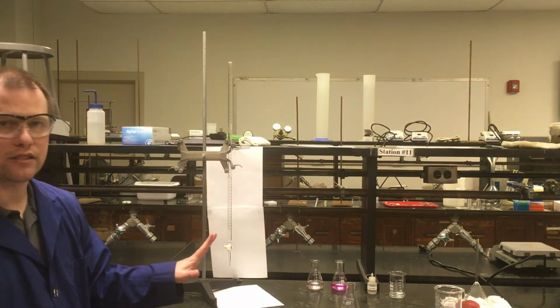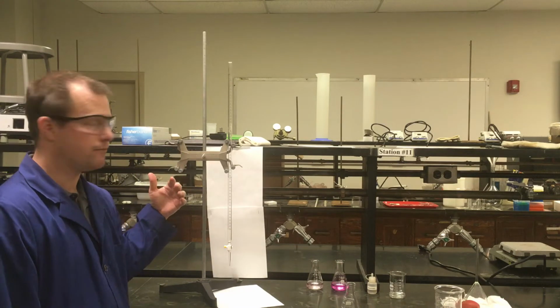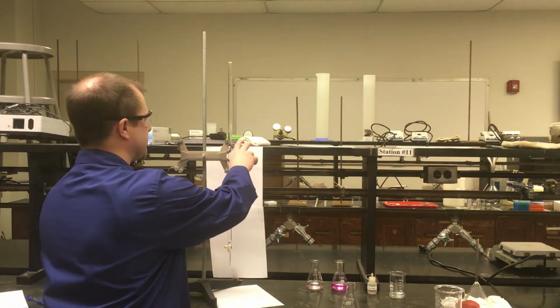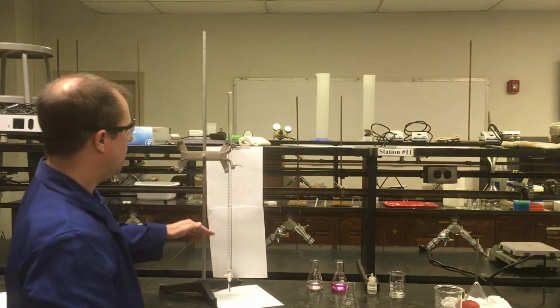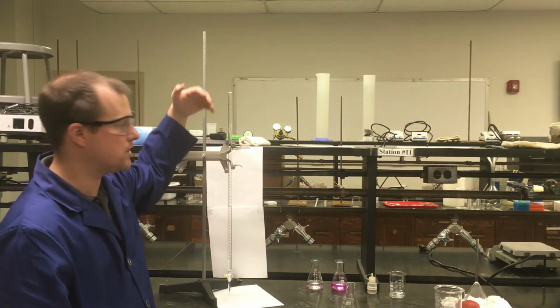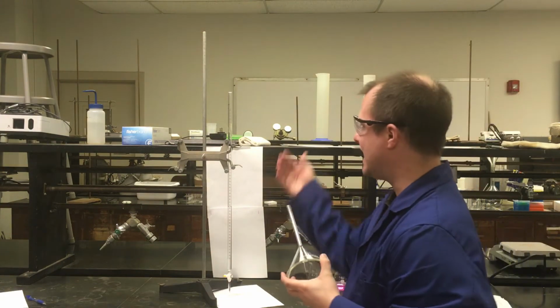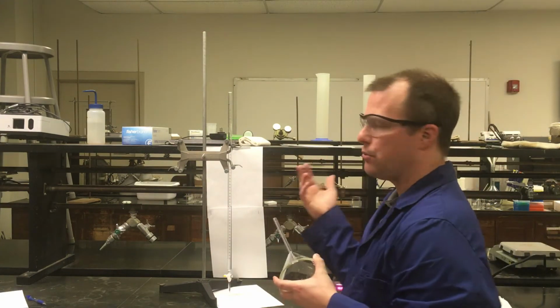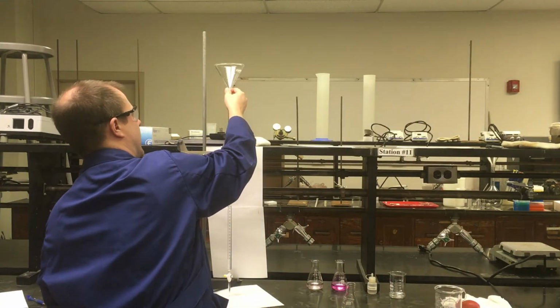So the other part of things for getting ready before I start the titration itself, I have to get the sodium hydroxide part ready. And so for this burette, especially since I'm not particularly tall, I'm going to lower this a little bit because I'm going to have to add the sodium hydroxide at the top to fill this up some. And generally speaking, if you're adding a base or an acid to a piece of glassware like this, probably want to be careful not to spill it on yourself, so a funnel is probably a good idea. So I'm going to go ahead and add a funnel to this.